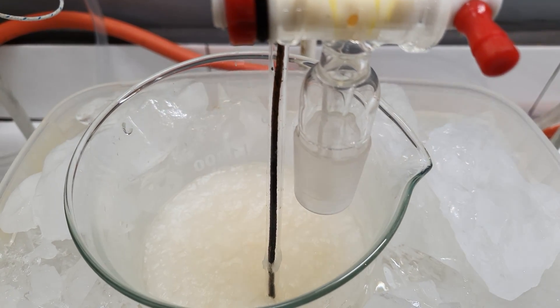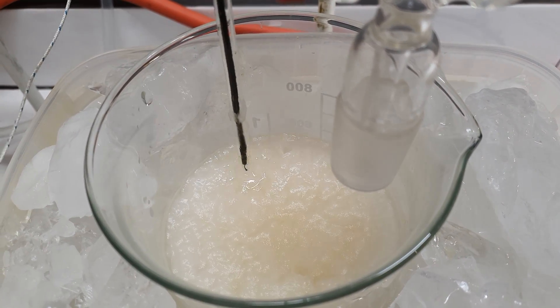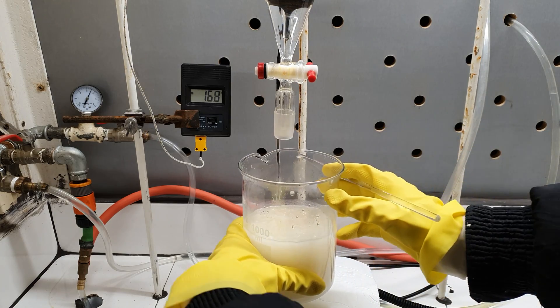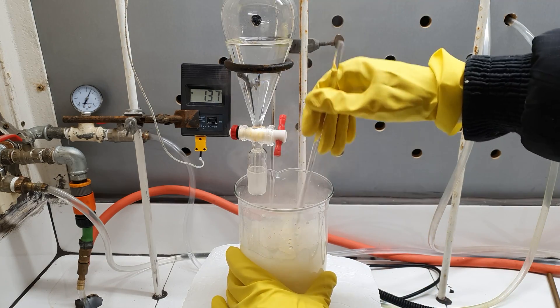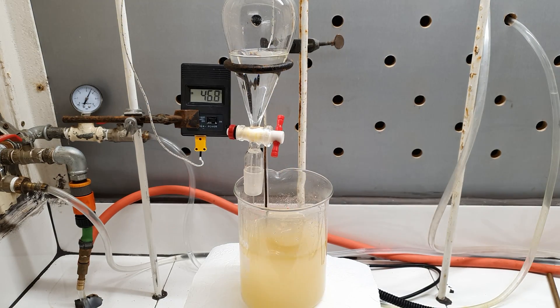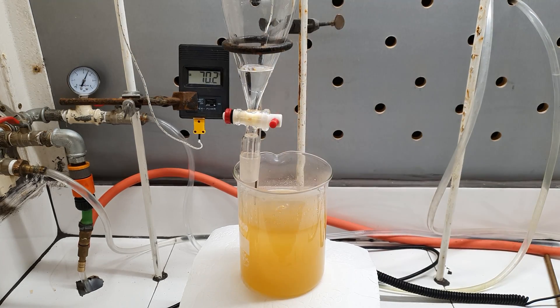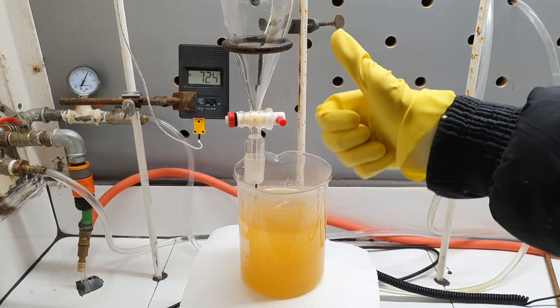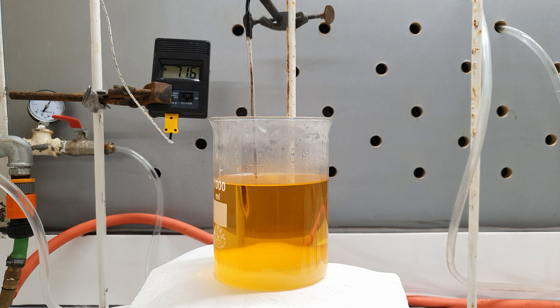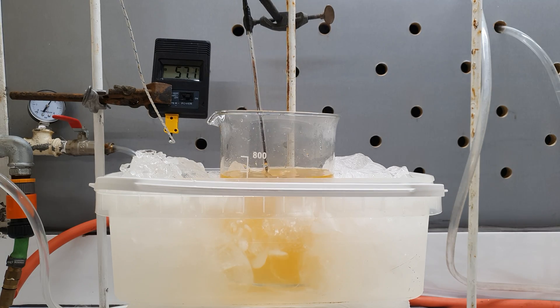However, going too low is also bad, because the resulting potassium sulfate is not very soluble. When the temperature is low it crystallizes, making the solution impossible to stir. At this point I had no other choice but to give up on the ice bath and continue adding the sulfuric acid, ignoring the rise in temperature. This didn't go as badly as I thought — even when the temperature was about 70°C, only a negligible amount of bromine formed, just enough to slightly colorize the solution.